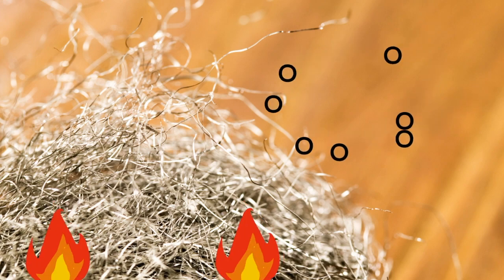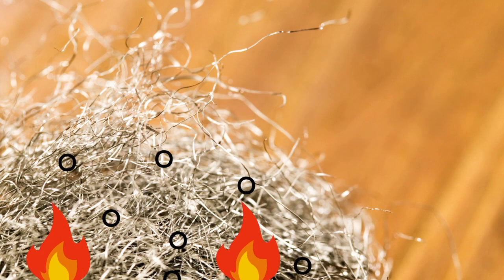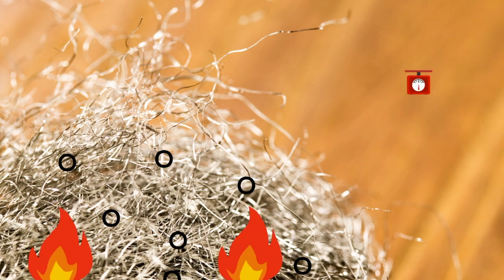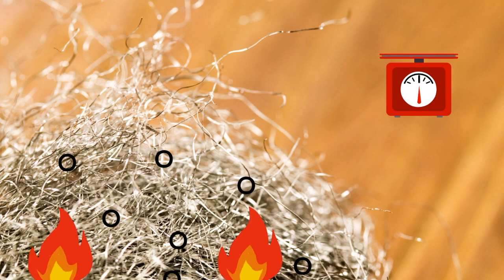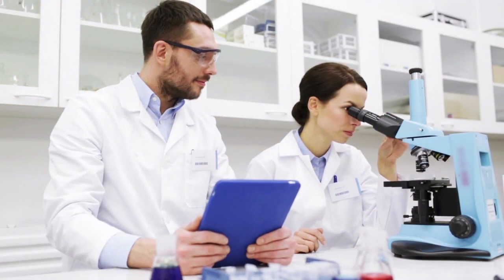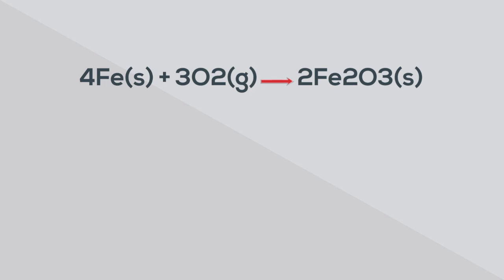When iron burns, it forms the compound iron oxide, Fe2O3. Since oxygen atoms have mass and are joined to the iron atoms, it causes the steel wool to weigh more after it is burned than before. If you were able to do this activity under perfect conditions, your clump of steel could weigh up to 30% more than the original mass. Here's the equation — so there we go: steel wool is gaining mass.